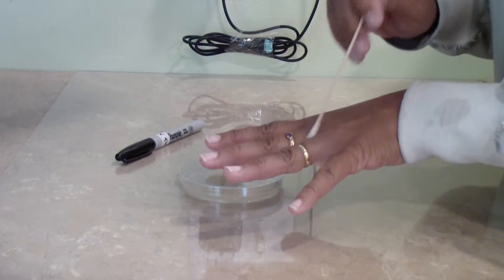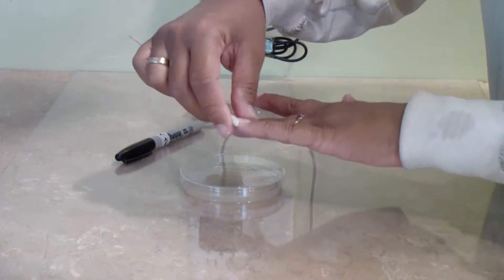Here, I'm sampling in between my fingers. And here, underneath my fingernails.